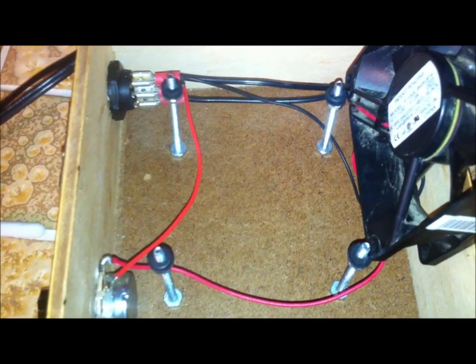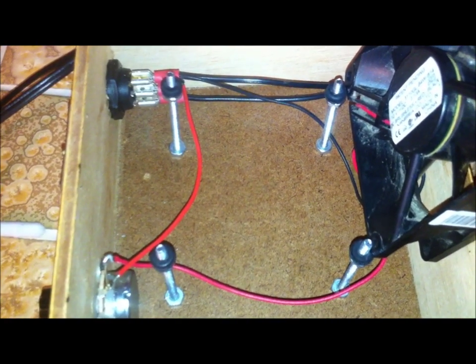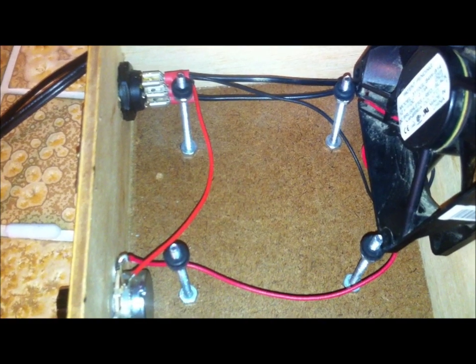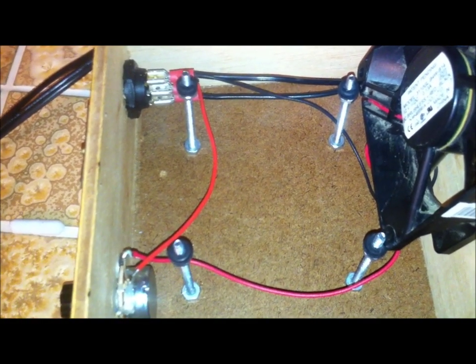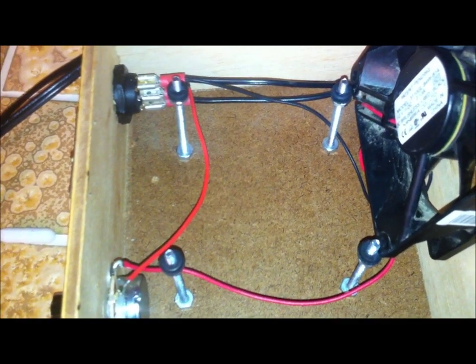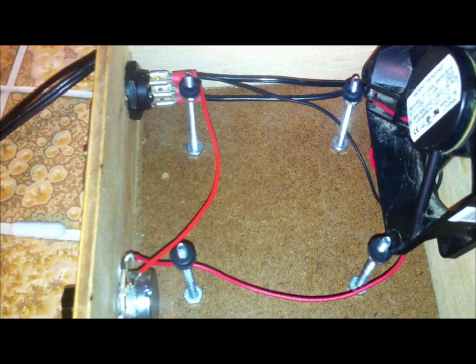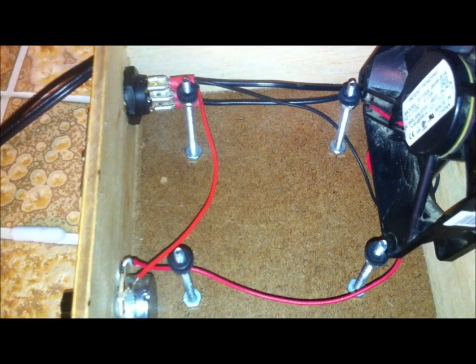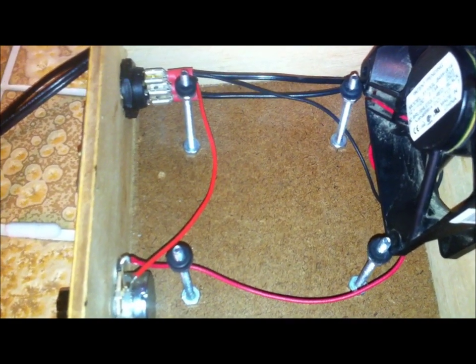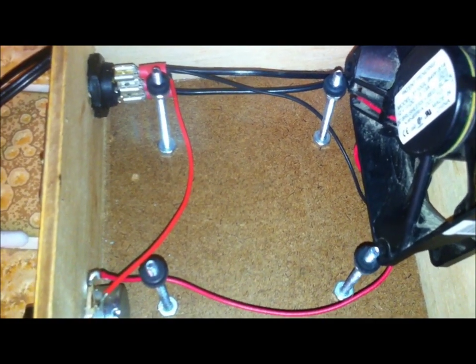All my components were bought at Radio Shack, $2.99 apiece. The toggle switch with the LED light has three posts on the back — numbered one, two, and three. Your number one post is where your hot wire from your AC/DC adapter goes — and that's the only thing that goes on that post. The center post is number two, and when you turn on your toggle switch, the LED light goes on and power is now being driven to your other components — the rheostat and then the fan. That red wire runs from the center post of your toggle switch to the center post of your rheostat.